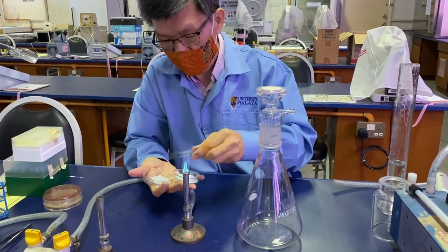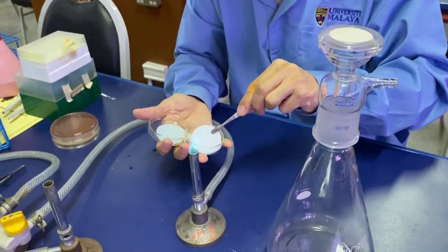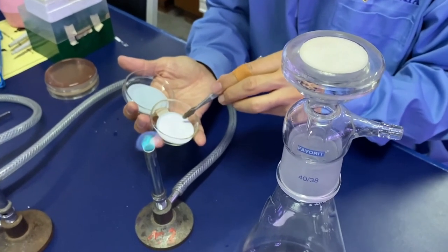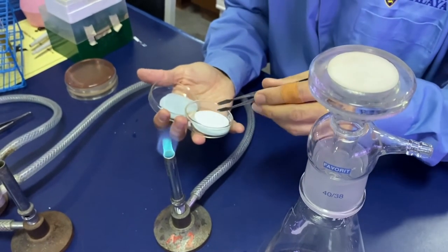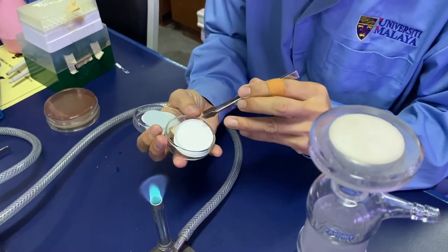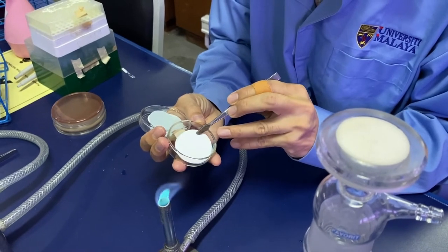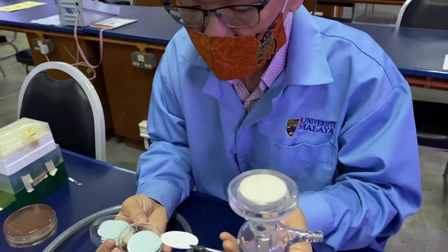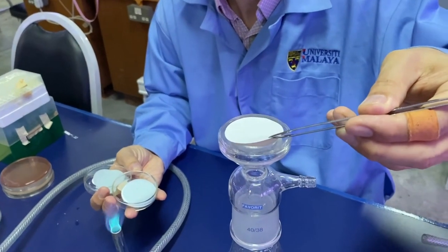The blue pieces are the separators between the filters. The membrane filter itself is the white one, and we are using a 0.2 micron membrane filter. The surface of the membrane filter should be shinier and should be placed on top.